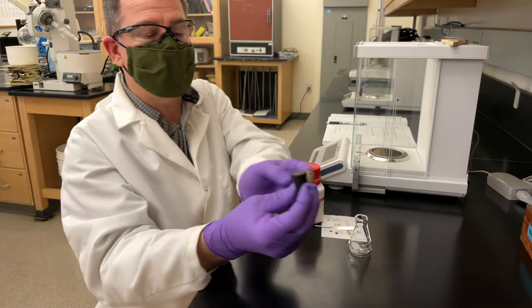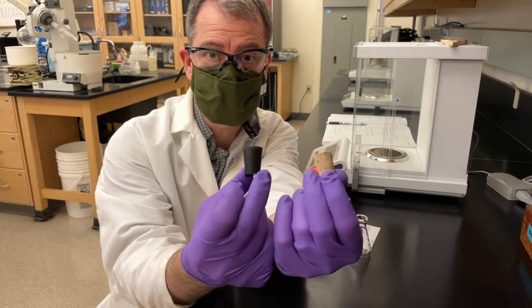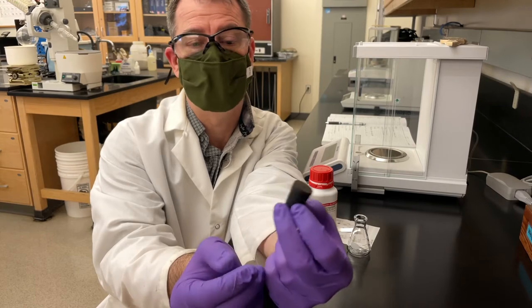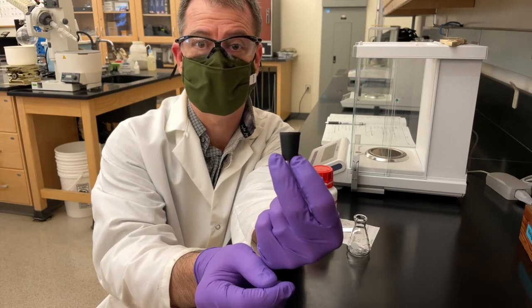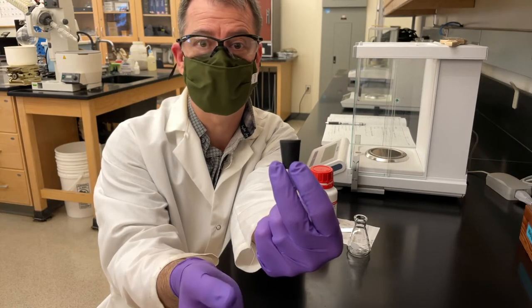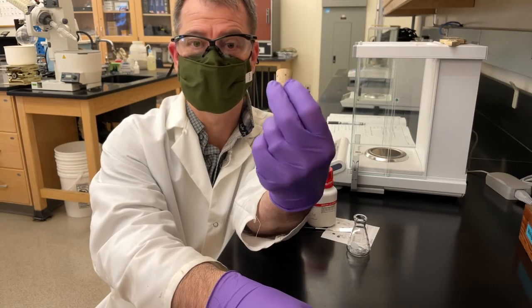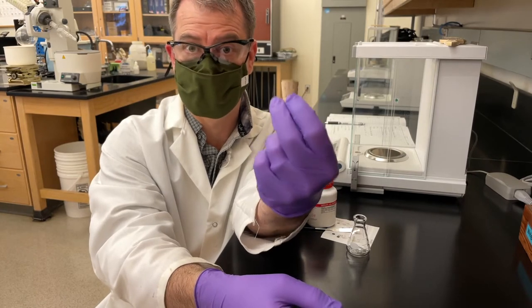Before we stopper it, I want to mention — I've got two different types of stoppers here: a cork stopper and a rubber stopper. Almost always exclusively, we go for a cork stopper. Why? Because rubber stoppers are an organic polymer and they absorb organic solvents like a sponge — they expand, degrade, and drop contaminants into our reaction. So throw the rubber stoppers away. Cork, being a natural wood product, does not absorb organic chemicals the same way, does not expand, and seals much better.